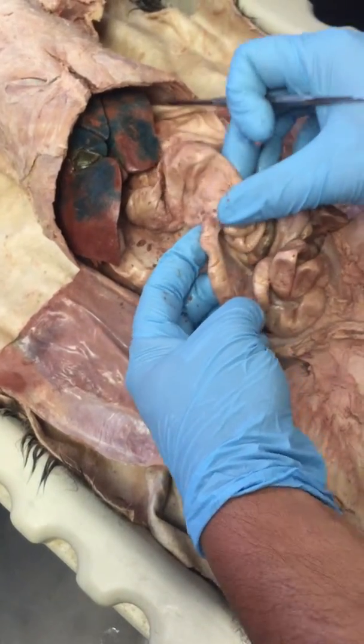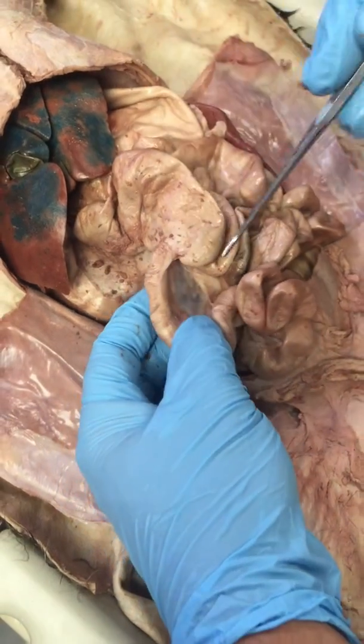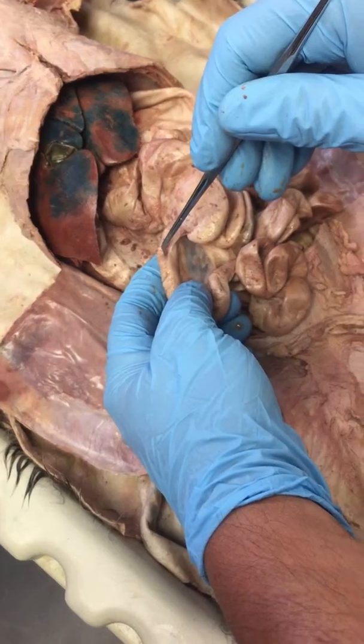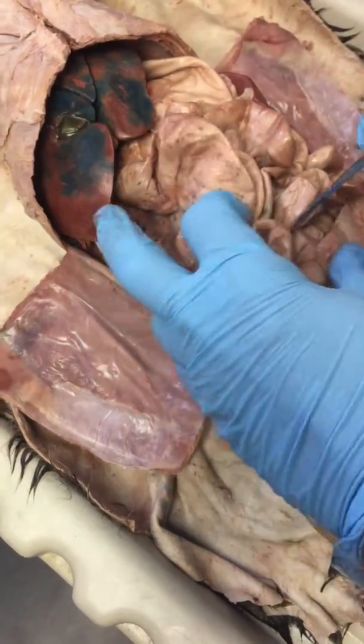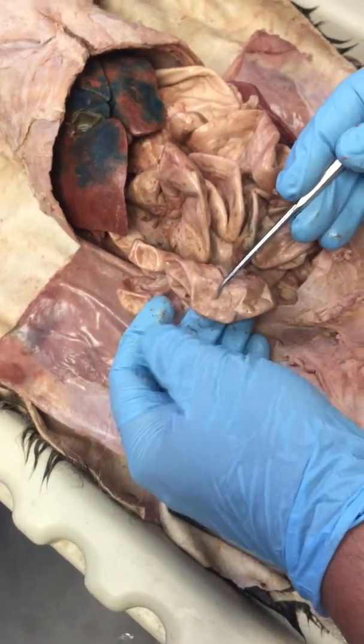Can you guys see that T? Looks like a little T intersection right there. Okay, so if I want the ileum, I'm going to put the pin right here where it's obvious that I want the ileum. I'm not going to sneak around and put the pin right here where you're kind of going, is that ileum or is that jejunum?